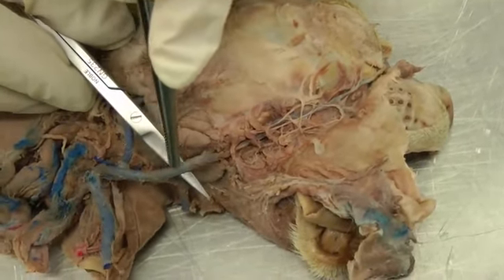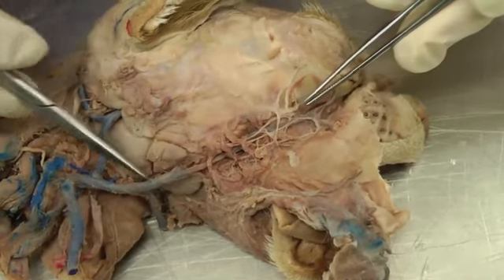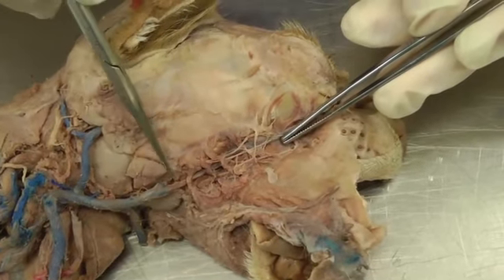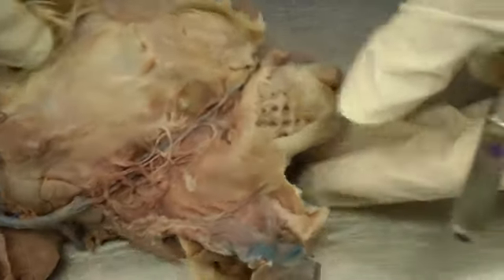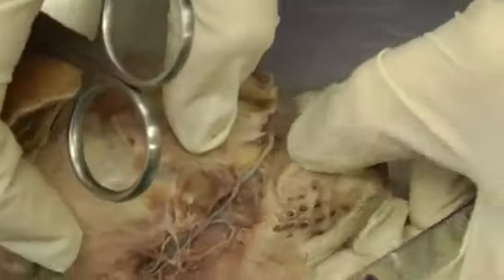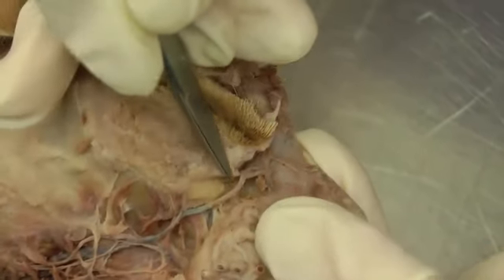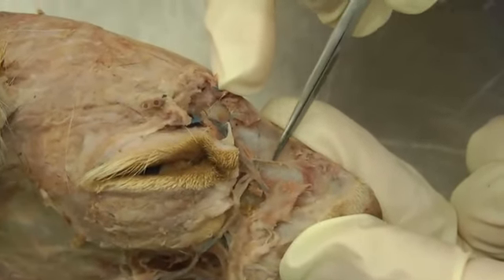and then the facial vein we're going to follow up and across the cheek here. So facial vein going up, and be very careful in this area. You have to keep these nerves for the next lab, so be very careful along here following that facial vein. And in the cat, it loses its injection here, and it gets very small. So here, the facial vein continues up, and we're going to see it break into those two branches that we saw in the dog, just not as well defined.